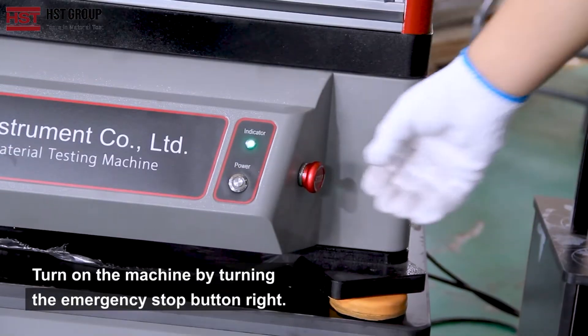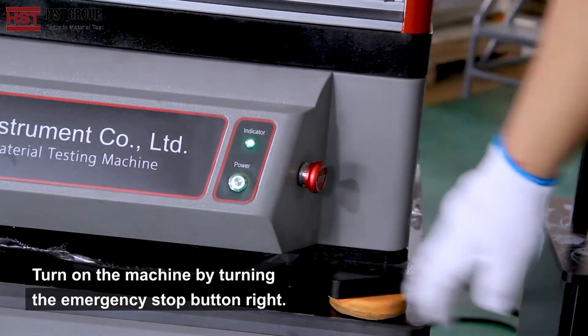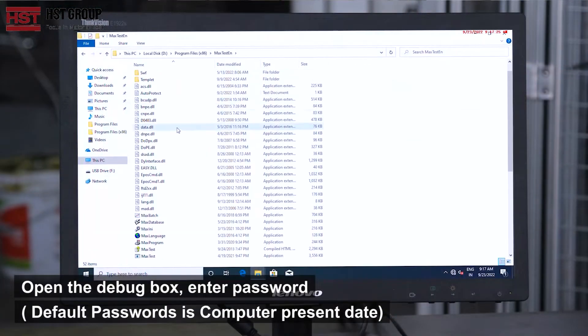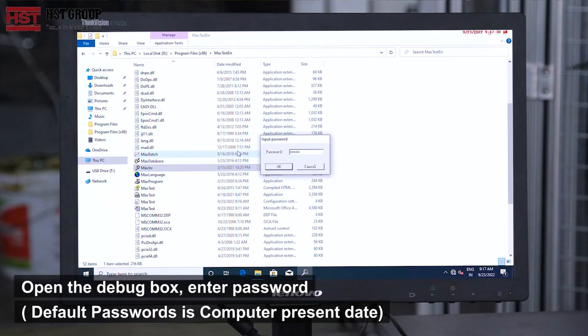Turn on the machine by turning the emergency stop button right. Open the debug box and enter the password. The default password is the computer's present date.